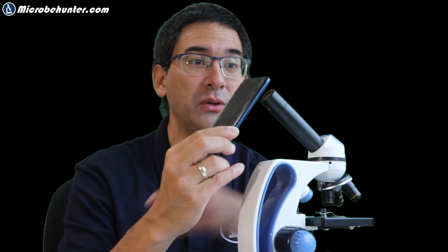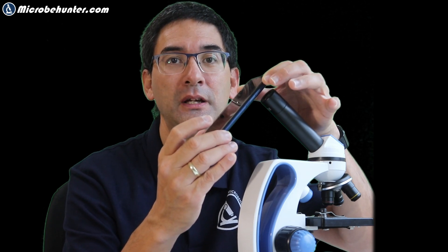The thing is, it's really important: if you want to get a picture using a mobile phone camera, you need a very steady hand. You have to center the camera lens over the eyepiece — not only in X and Y, but the tilt has to be correct, and also the distance, and that's where it gets difficult. It's almost impossible to hold it steady even with two hands, and at the same time you want to concentrate on the picture. You can't even adjust anything on the microscope because you only have two hands.